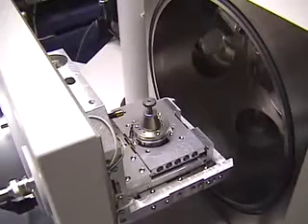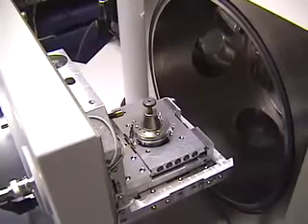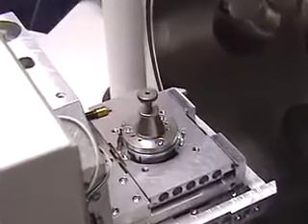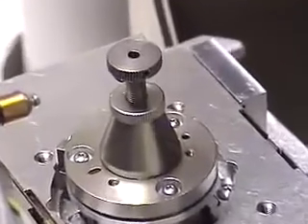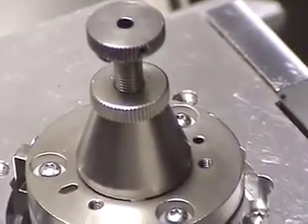Samples can be mounted on the stage in the centre of the shiny circular rotation axis. As well as rotation, the stage can move in all directions and also tilt, while the centre screw can be screwed in and out to change the sample height.